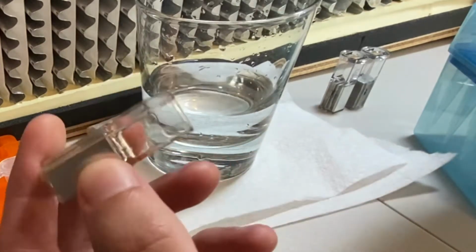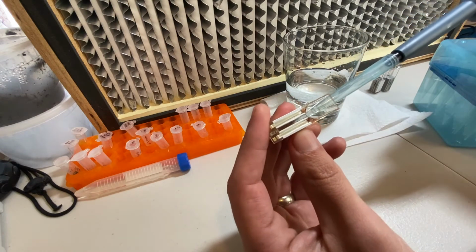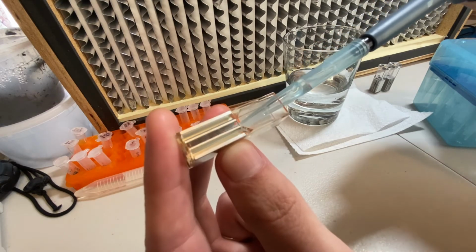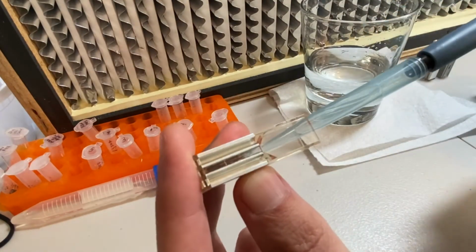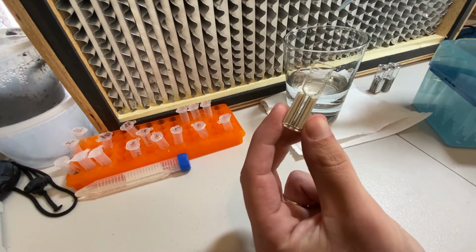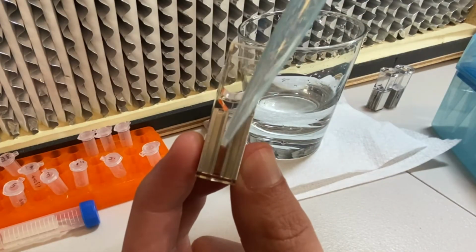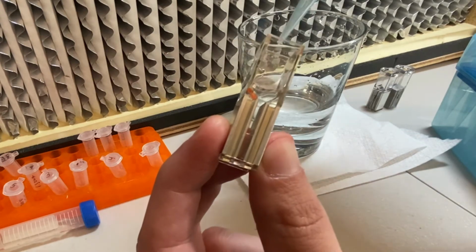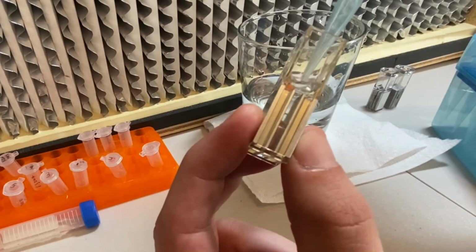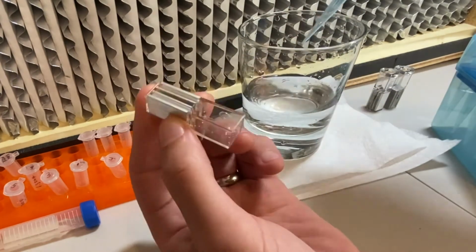So the question is, how do we get out that bottom amount? I saw one video where a guy leaned it like this, and that seems to be kind of working. But I think generally it looks like 1 milliliter will fit. And also what's probably going to happen is the electroporated cells are going to get mixed in with this media. So even if I'm not able to draw up all of the media, some of the transformed cells will be mixed in with this stuff here that I draw back out. That was pretty good.